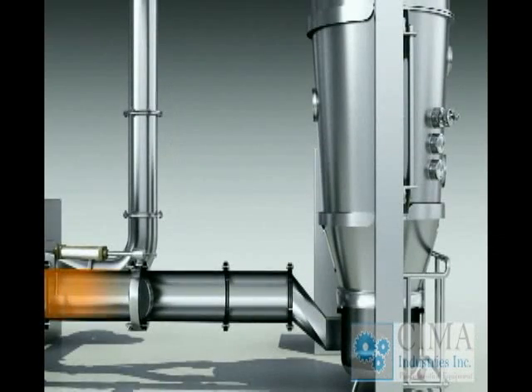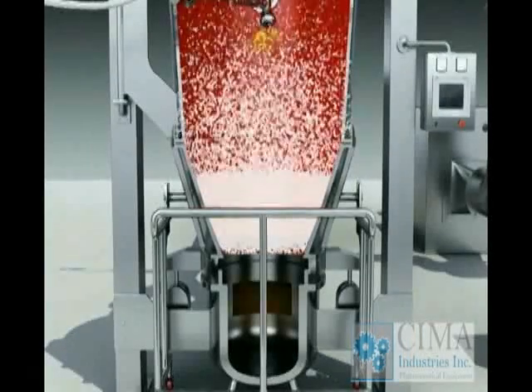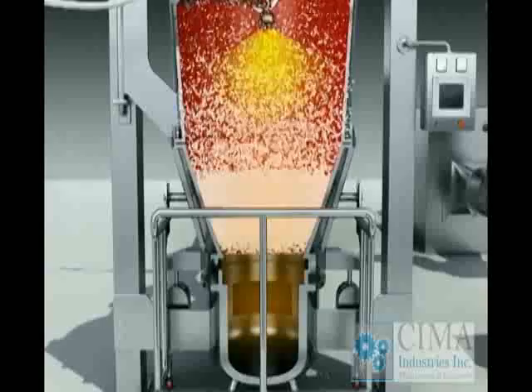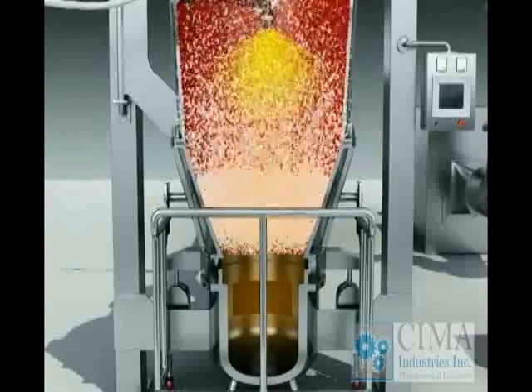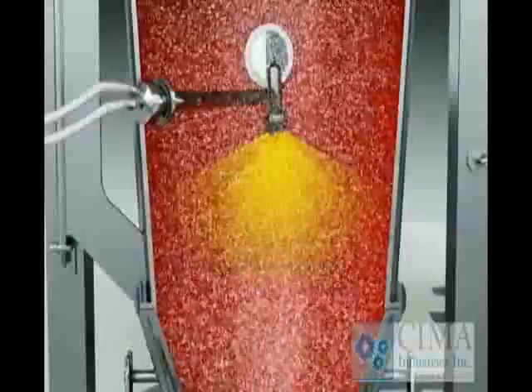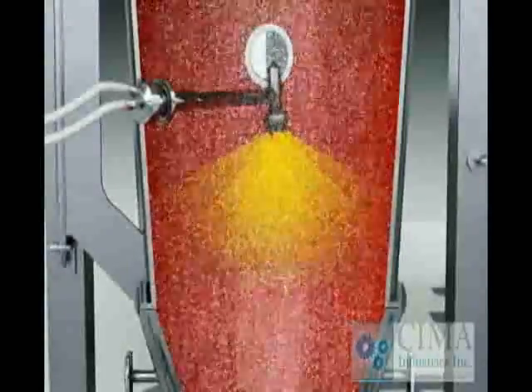Heated and filtered, sometimes also dehumidified, air enters into the fluid bed from the hot air cabinet. The powder should be fluidized when the air velocity is high enough. The fluidized powder is brought up to the expansion chamber and passes through the spray nozzle, contacts the atomized mist sprayed from the spray gun by compressed air.